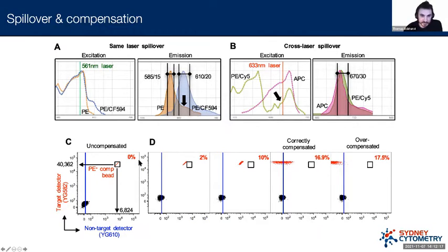So if we apply a compensation matrix, with the value that we're applying to this pair of detectors, we can correct the signal. If we apply a small amount of compensation, this signal starts to get moved out of the non-target detector on the x-axis, whilst keeping its position in its primary detector on the y-axis. So at 2%, it's moved a bit to the left. At 10%, it's moved a bit further. At 16.9%, it's been corrected. It's been taken from spilling over, appearing in both detectors, and it's been removed from the non-target detector. And that's where it ends up there.